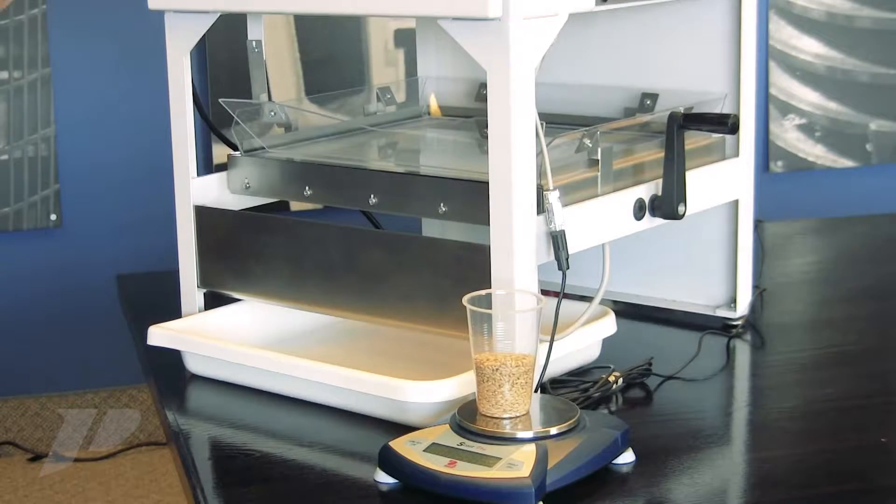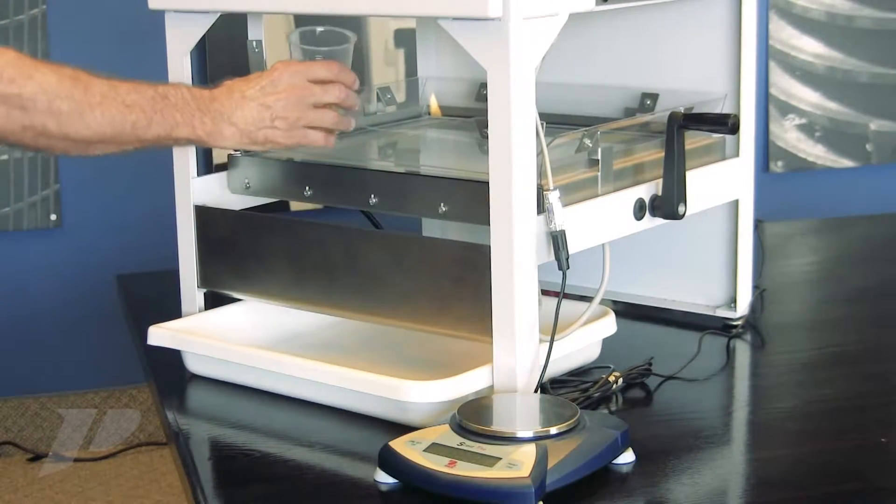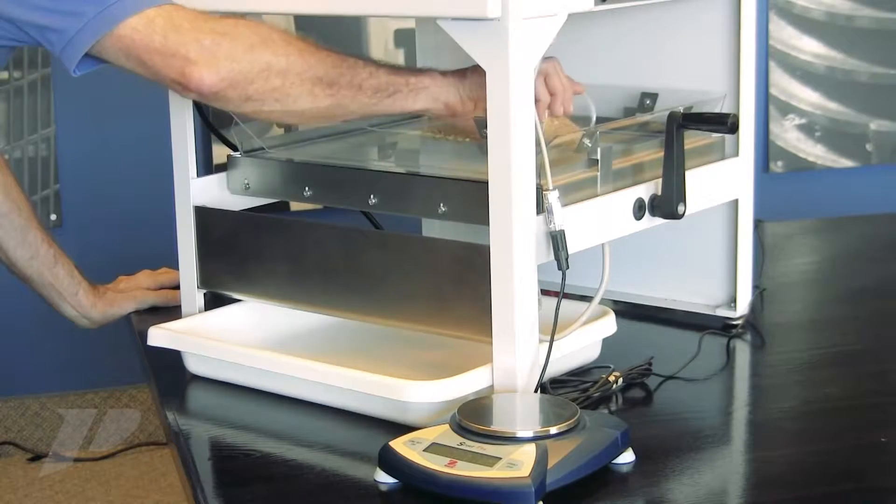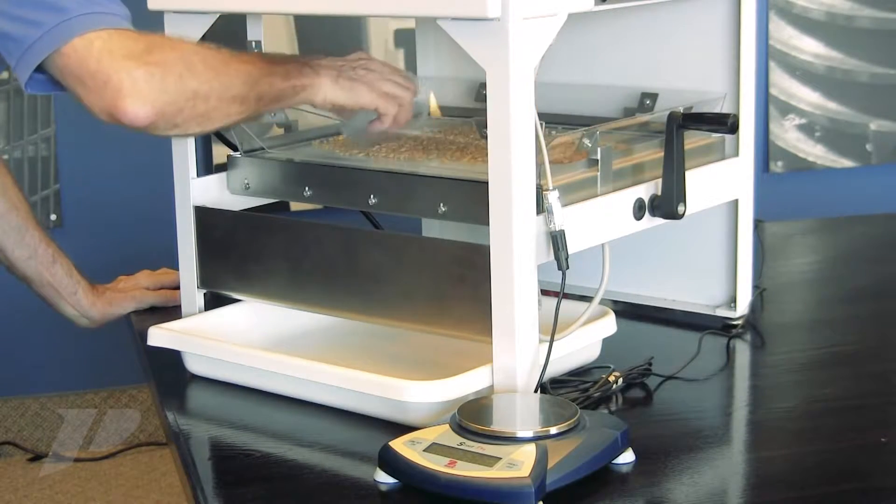Reading scale, we have a weight of 105.89 grams. Pour the sample on the stage and spread it out a little bit.